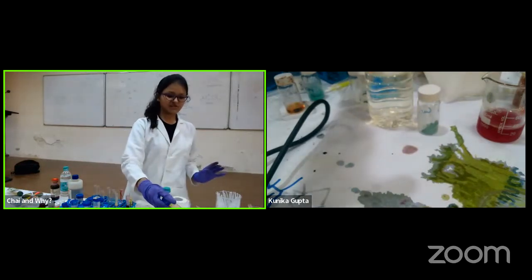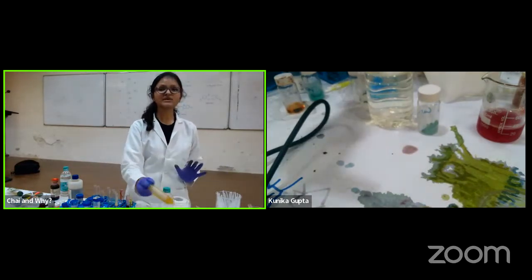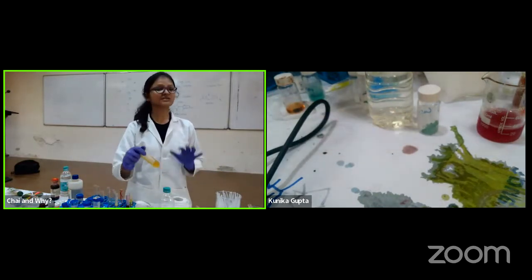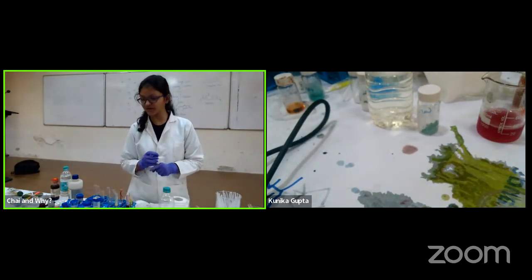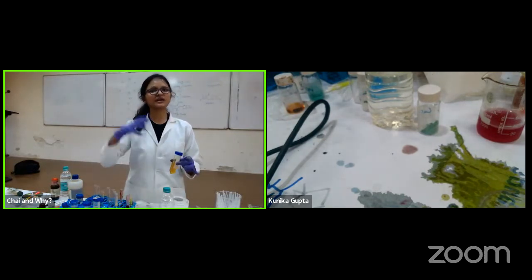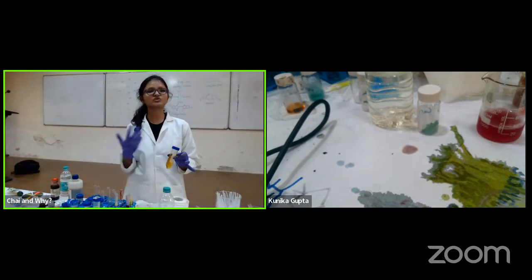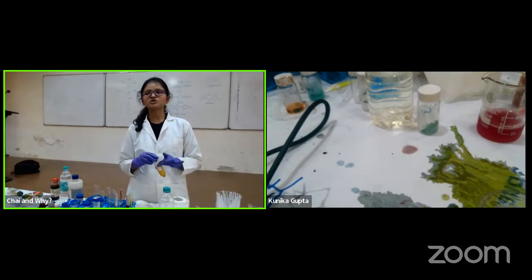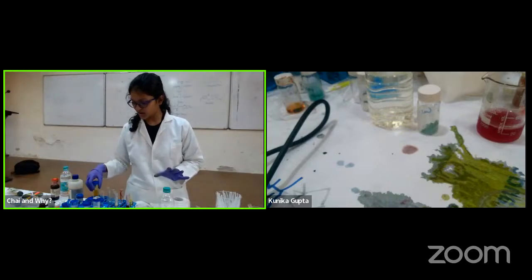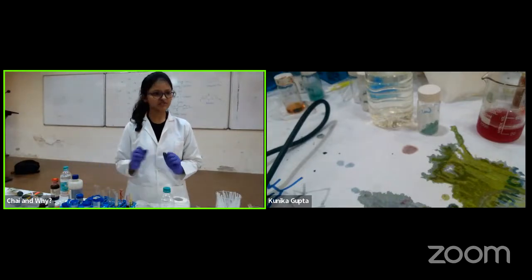So what I hope is that there is some issue with the amount that I am adding. Otherwise, because it's redox chemistry, you have to understand why it is not working. If there's a lot of reducing agent compared to the oxygen being supplied, it eventually won't change the color. Okay, that's the only thing happening. Otherwise, this works perfectly fine. We can show you this later sometime.